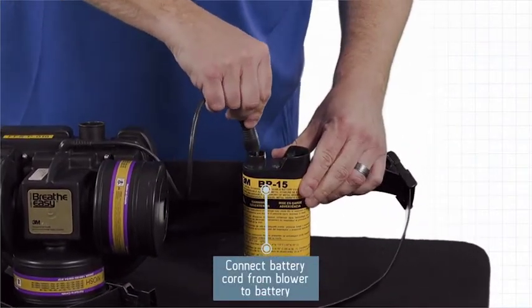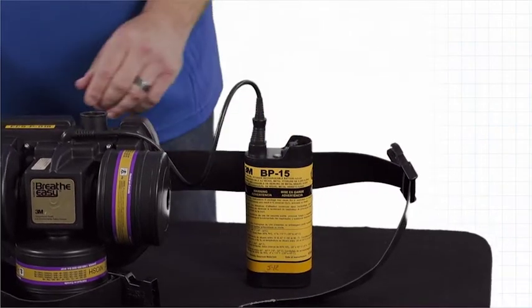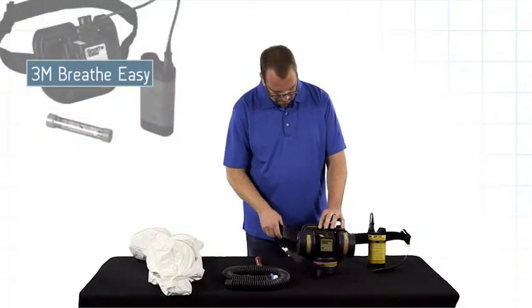Connect the power cord to the battery. Inspect and adjust the belt.